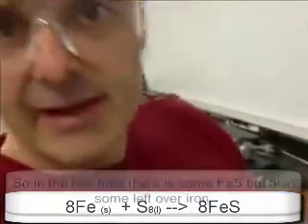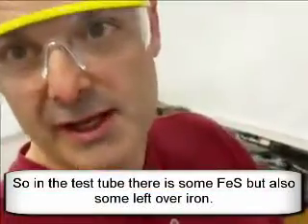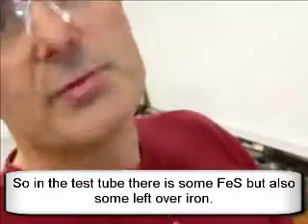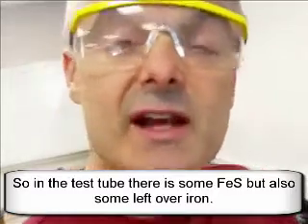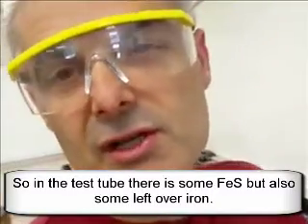because I think I put too much iron in there. You'd have to figure out how much you'd want to add to it. But let's assume that I did. It would be unattracted to the magnet, which means you have produced something else, in this case iron sulfide, as opposed to just iron and sulfur.